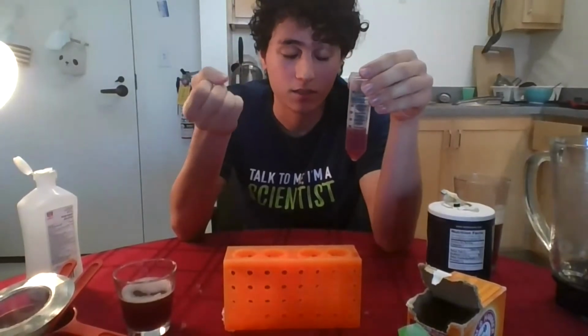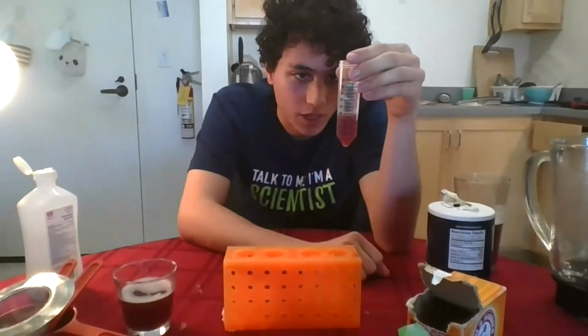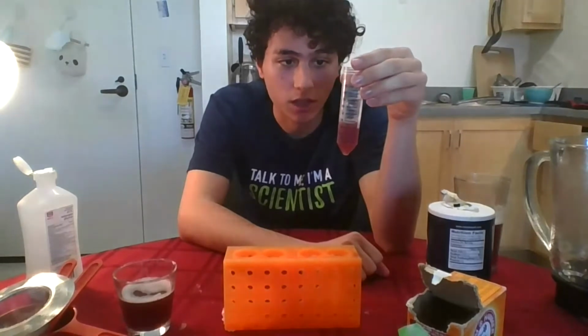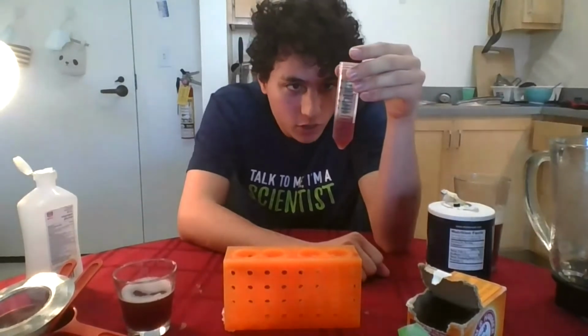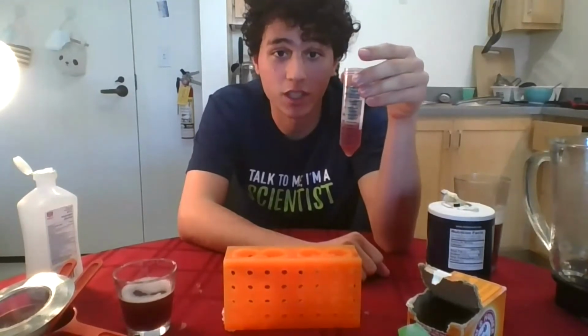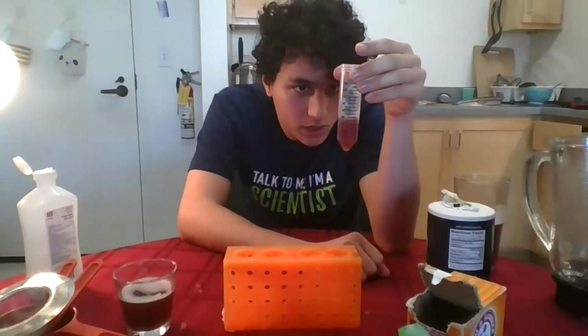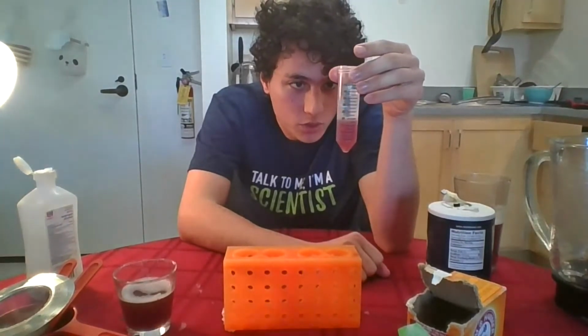And that's the end of our procedure. So we'll just give it a couple more seconds so it happens. It might be less evident and it's going to be kind of hard to show on camera, but I can already see some of these cloudy mists of DNA chunks that are forming. So I can already see it. And I'm going to give it a couple more seconds so that more of it comes out of the solution.